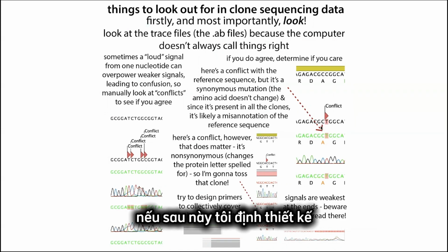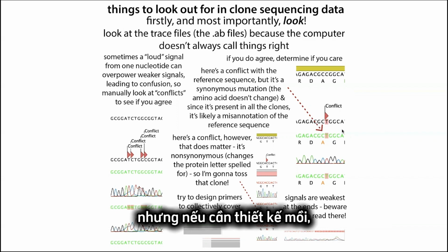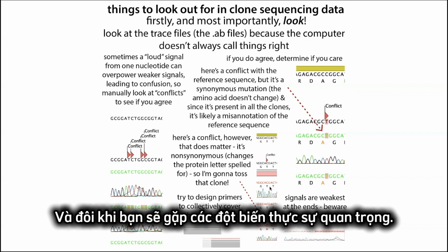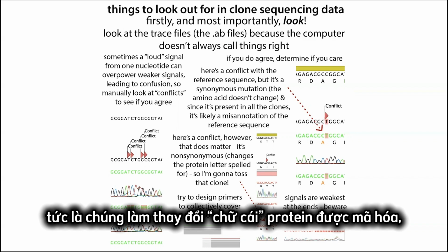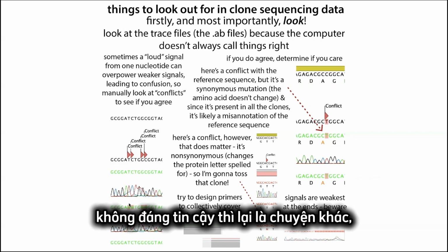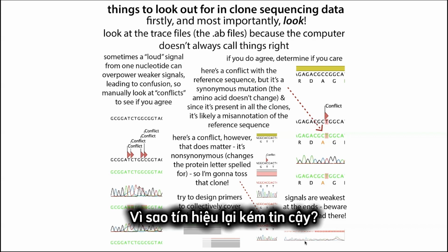But it would be important to know if I was going to design, say, a primer later that was going to cover that region. In terms of the actual protein making, it doesn't matter. In terms of designing a primer where I needed to know the sequence, it could matter. And sometimes you'll get mutations that really matter for both cases, that are non-synonymous, so they change the protein letter that's spelled for. These are clones that you definitely want to get rid of, as long as that signal is reliable. However, if you have a signal that's unreliable, then that's a different story. It might still be okay. And why might it be unreliable?